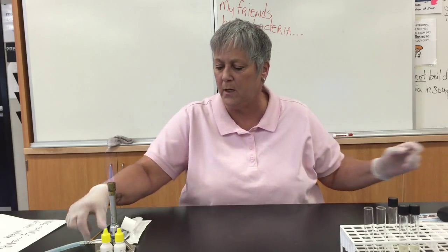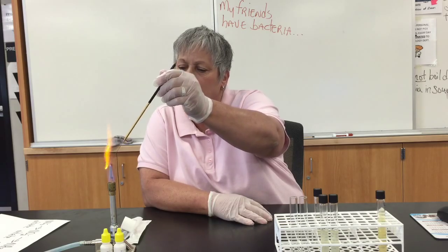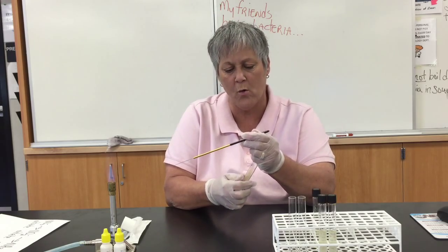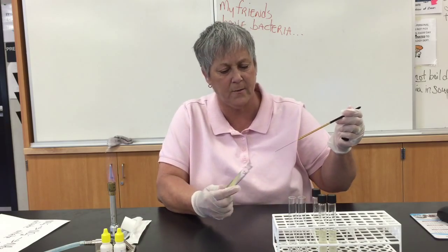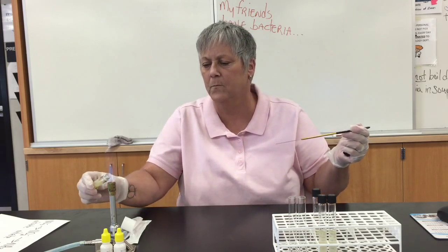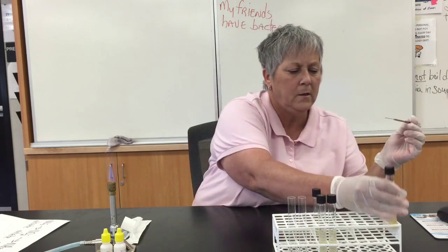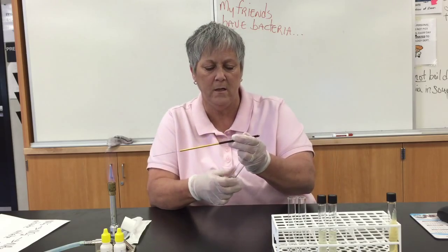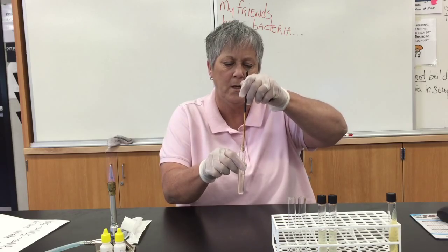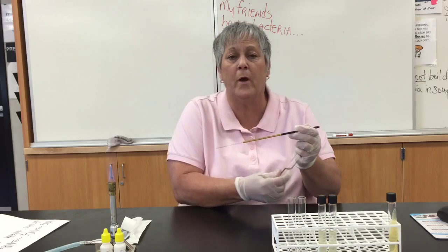What I'm going to do is go ahead and inoculate my nitrate broth. I'm just going to carefully remove a small quantity of the test organism from my slant, and give that loopful of organism a swish into my nitrate broth. Then this tube is ready for incubation.